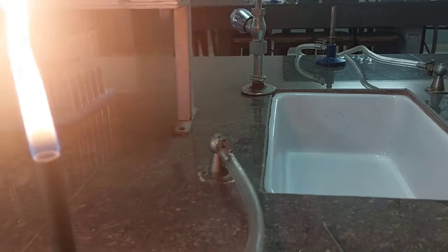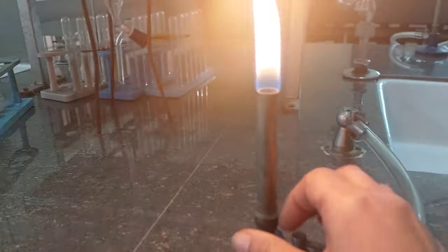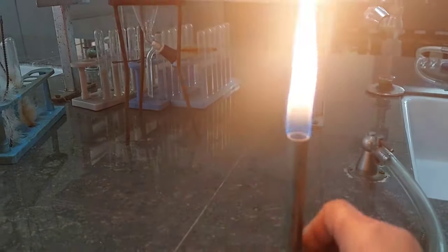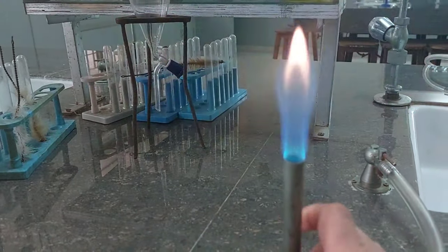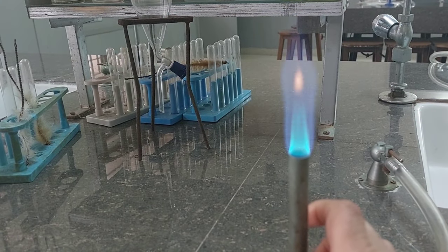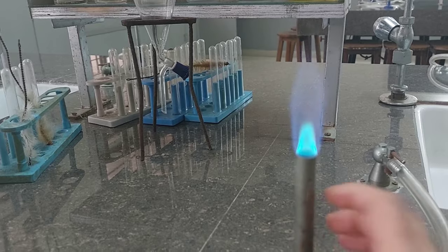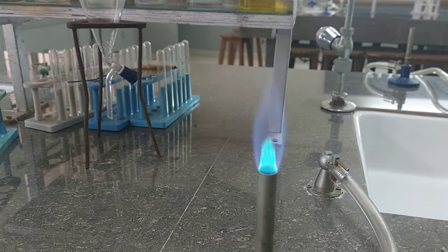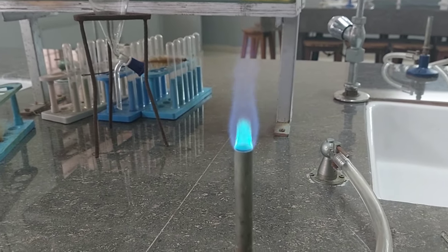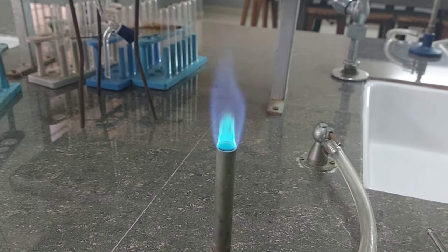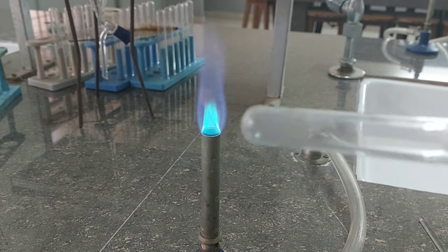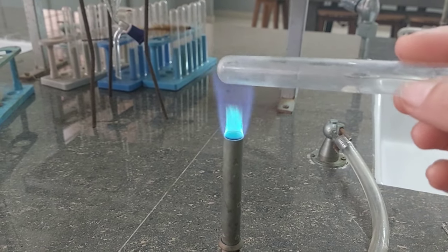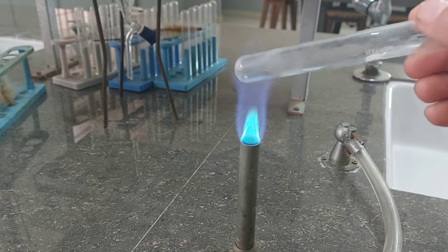And now I change the flame. I am making the opening larger, allowing more oxygen through it. And now you can see it's a clean flame. And let us heat the test tube again. I take a test tube and now heat again in this flame. So just see, does it become black now?